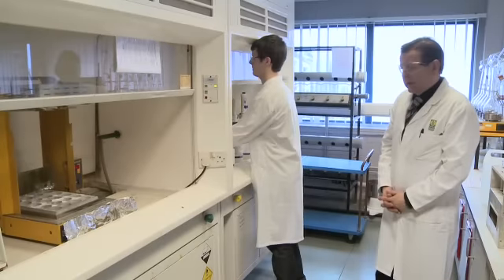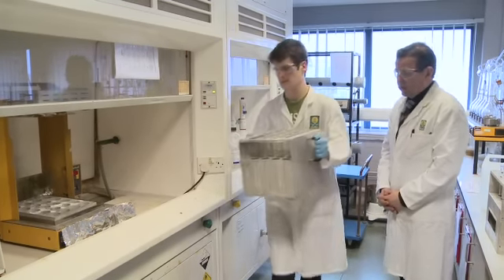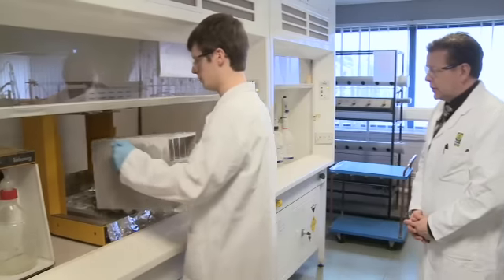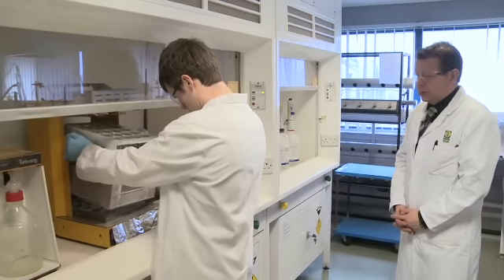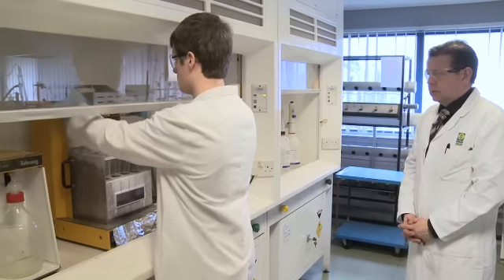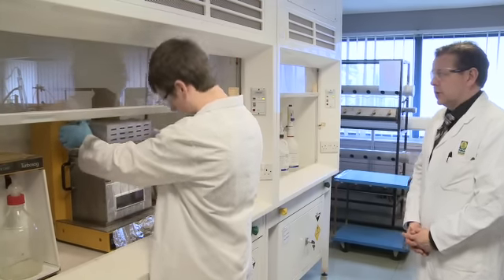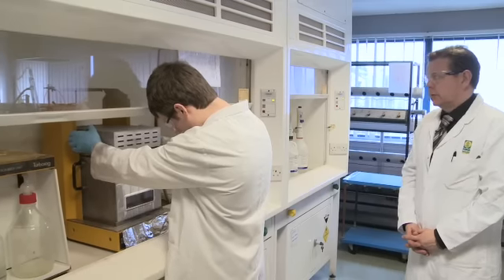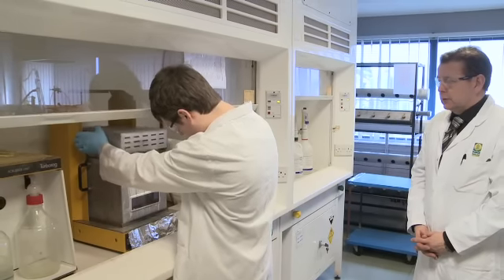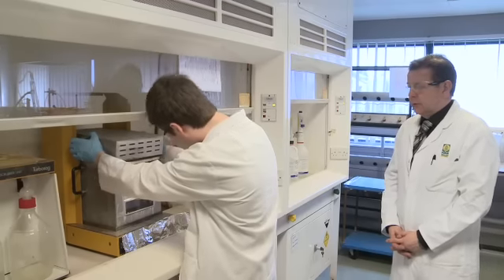To now continue with the digestion process, the tubes are taken and placed on the digestion block, heated at 400 degrees for 1 hour to continue reduction and breakdown of the proteins within the meat. The extraction hood is placed over the top of the tubes to collect any acid fumes evolved.